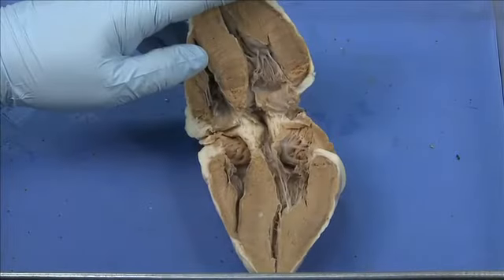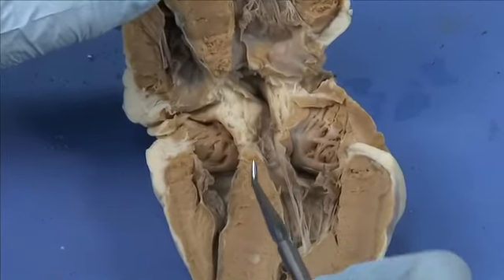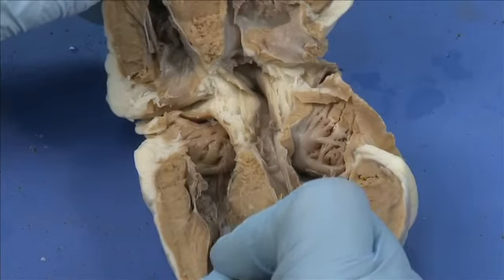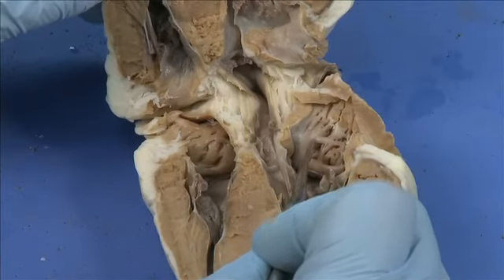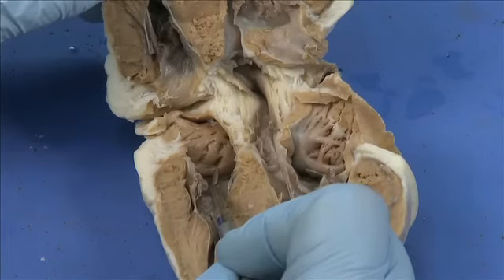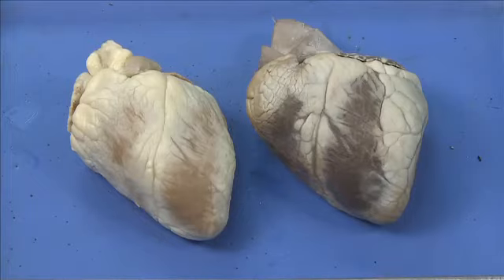The last structures we'll look at on this internal dissection are the pectinate muscles — these are the ridged muscles that line the atria. You can see them on both the left side and the right side. This concludes our dissection of the sheep heart.